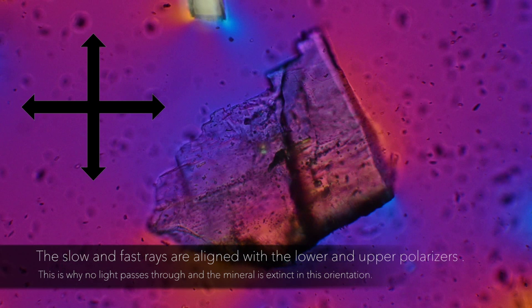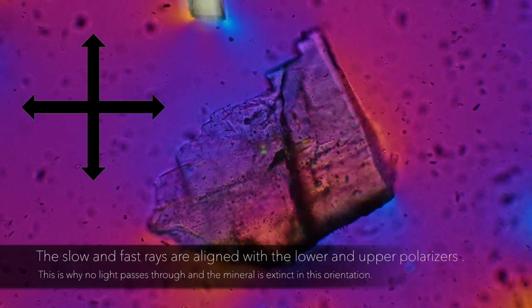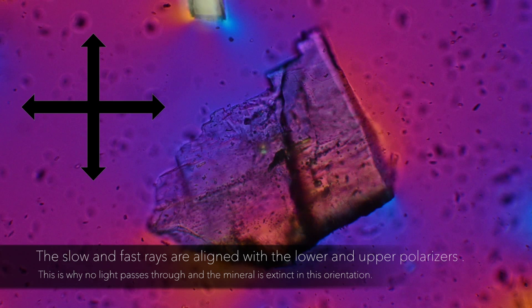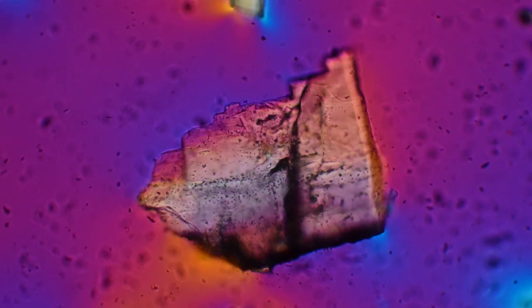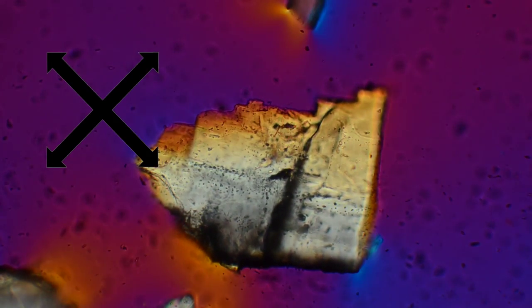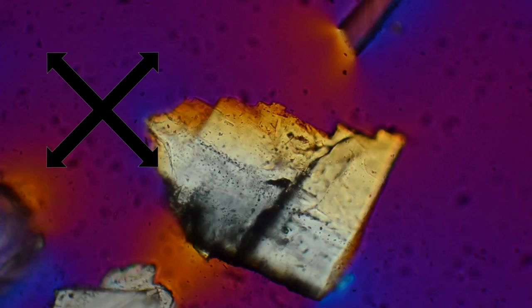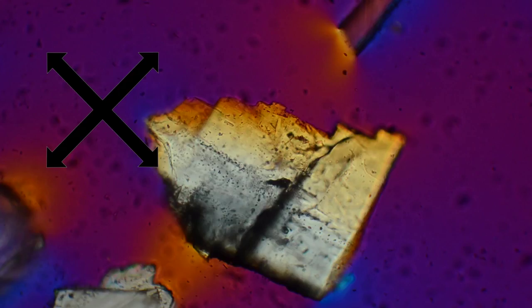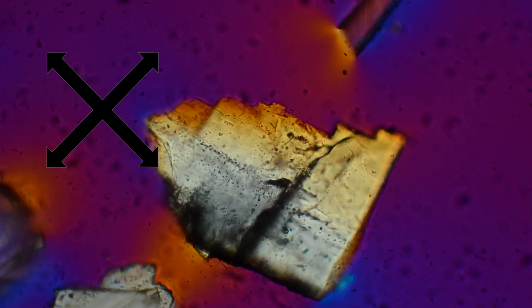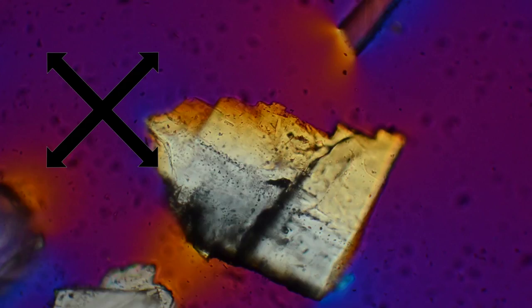The slow and fast rays are aligned with the lower and upper polarizers. This is why no light passes through and the mineral is extinct in this orientation. I rotate the stage another 45 degrees to the next maximum illumination position where the slow and fast rays are at 45 degrees from the polarizer directions. Here our mineral is displaying first-order interference colors. One of these maximum illumination positions is where our fast ray is propagating and one of these positions is where our slow ray is propagating.